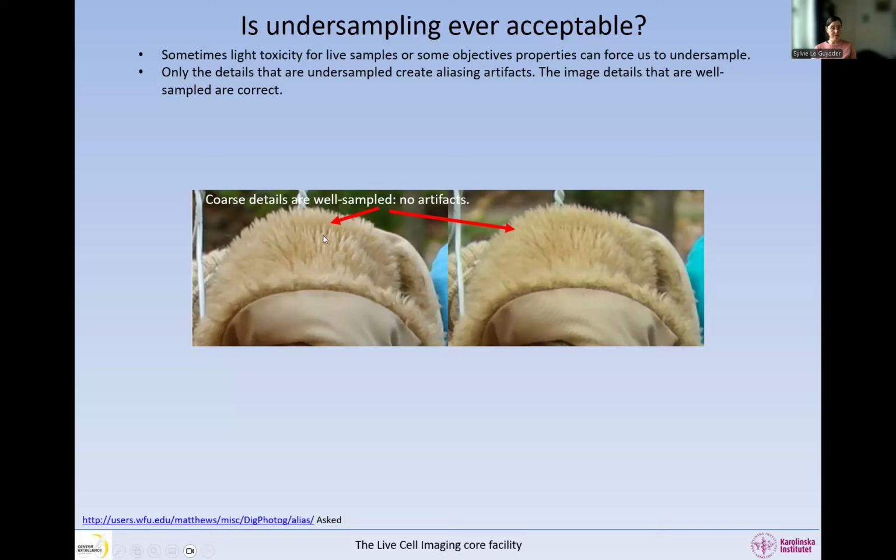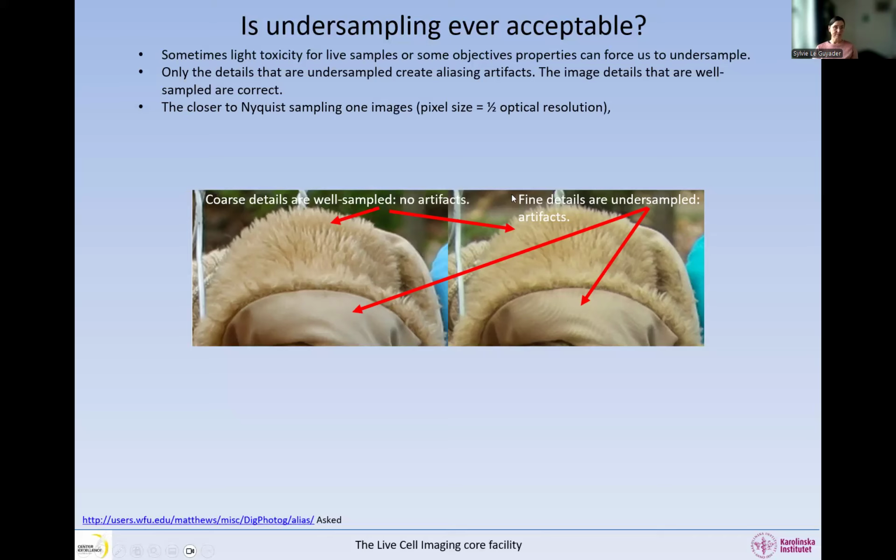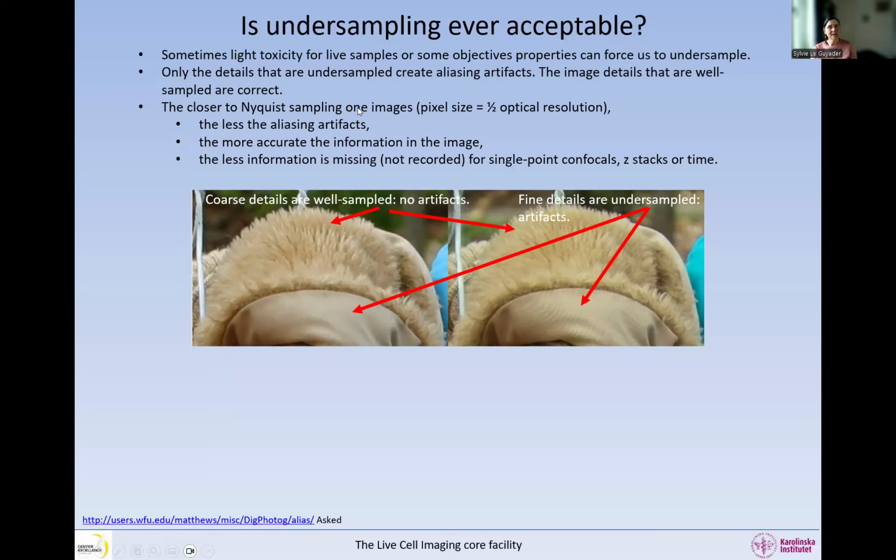The objective resolves everything in this image, not everything. It resolves this area and this area. But here we are sampling according to Nyquist in this area. However, in here, we do not create any artifacts. However, in here, we can see the moiré artifacts, and that is because in this area, the objective resolves these details, but not the digitalization, so not the camera. So only the areas in the sample that are resolved by the objective, but not by the digitalization, will create artifacts. As we get closer and closer to Nyquist, so if we get smaller and smaller pixels, we are creating less and less artifacts in the image. So we have less and less aliasing artifacts.